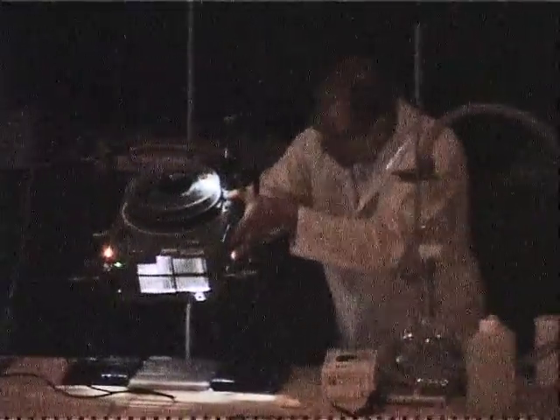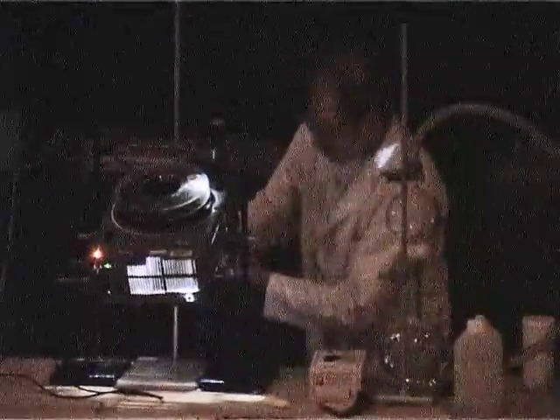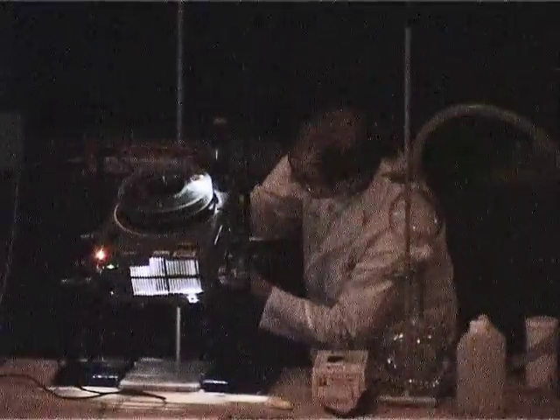Chris has just put the tubes in front of the light source here. Inside the tube, we have hydrogen gas and chlorine gas.